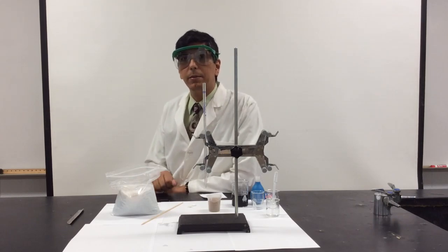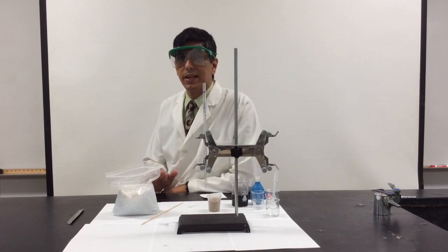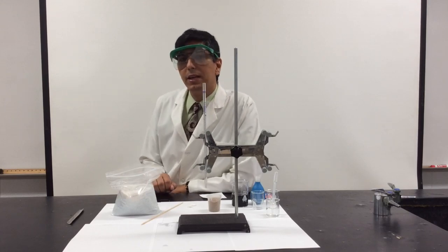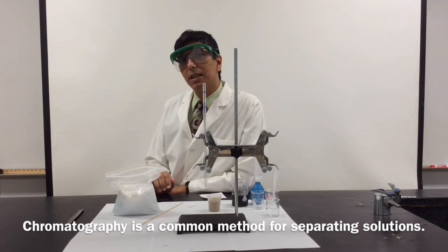Welcome back to Chemistry. My name is Jeremy Krug and it's time for another exciting chemical demonstration. Today we're going to be building a chromatography column and the purpose of this is to separate a mixture.